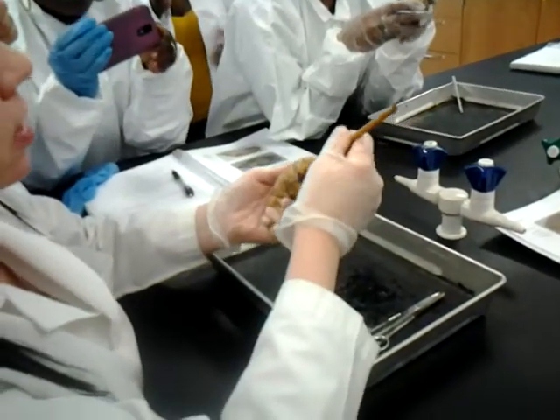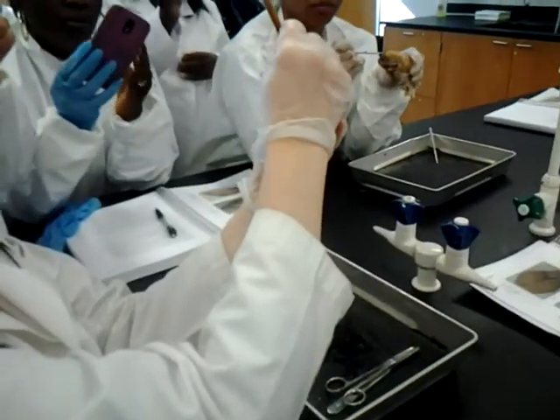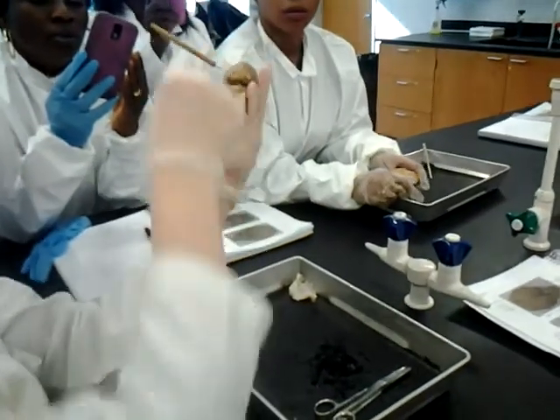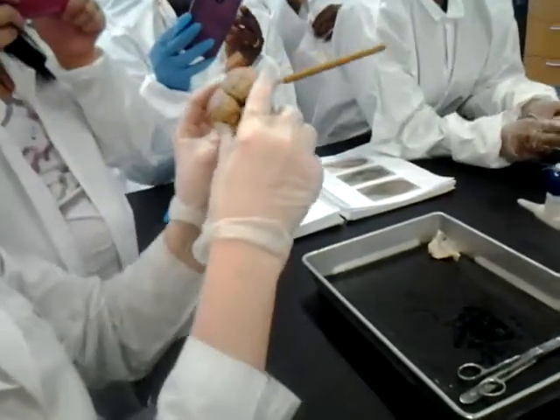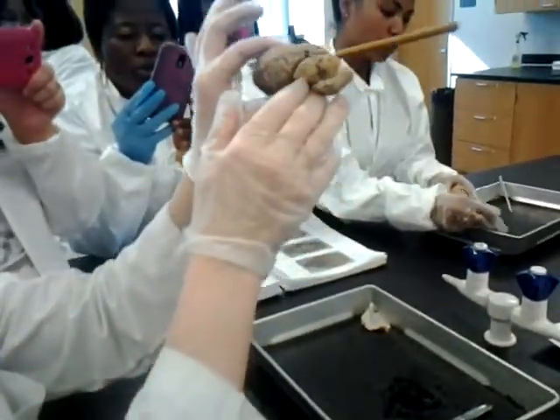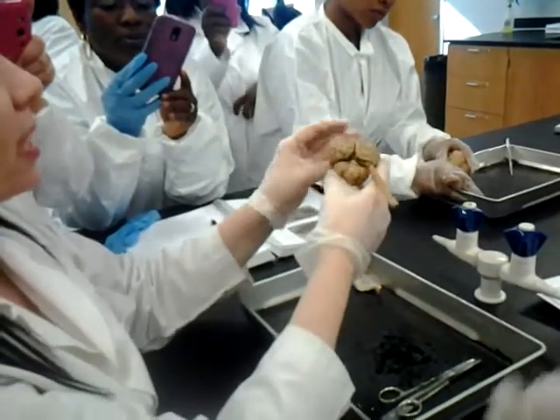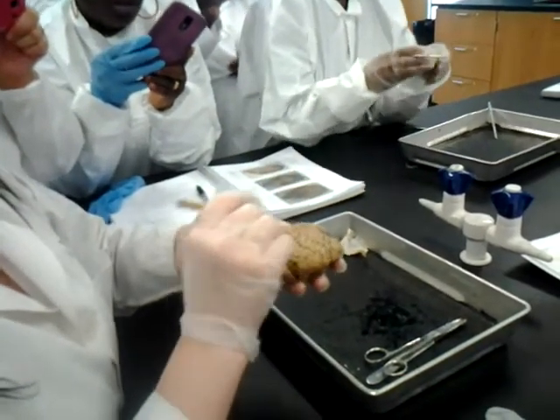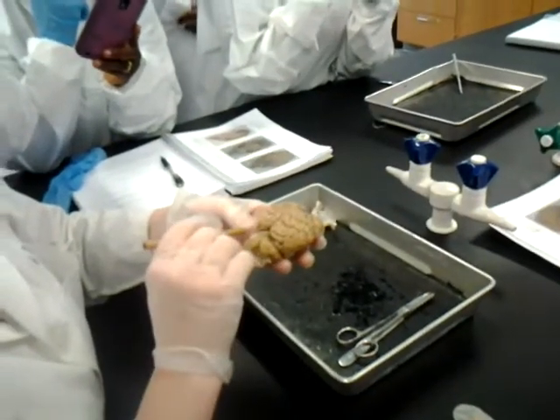So for lobes, this would be the frontal lobe, and I'll make it obvious, this would be the parietal lobe. Make sure I'm way on the side for the temporal lobe. And then, of course, to the back for the occipital lobe. So those are pretty obvious. Know your functions for each of those, just like you need to know for the plastic model. This slit right down the middle is the longitudinal fissure. It separates the right and left cerebral hemispheres. Good.